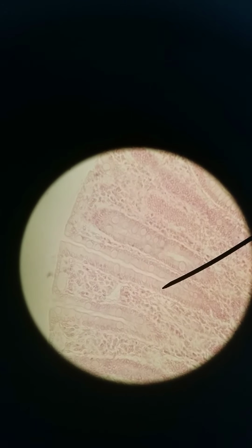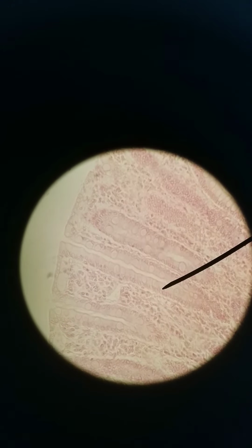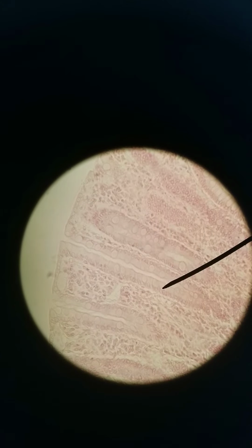We need a lot of mucus in our large intestines because we've already absorbed most of the nutrients in the small intestines. By the time we get food to the large intestines, we want to absorb water. And if we absorb water, we're compacting feces, and drier feces means it might cause damage to the lining. So we need mucus to help lubricate the feces as we're producing it. So that is the ileum and then the cecum.